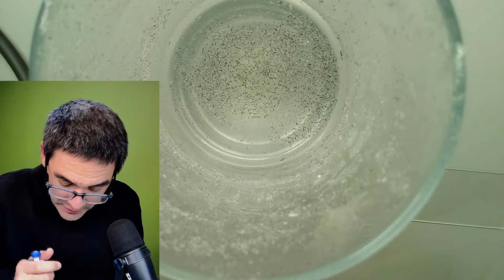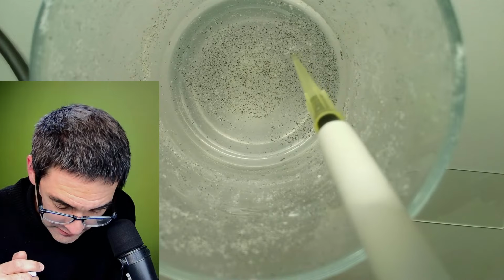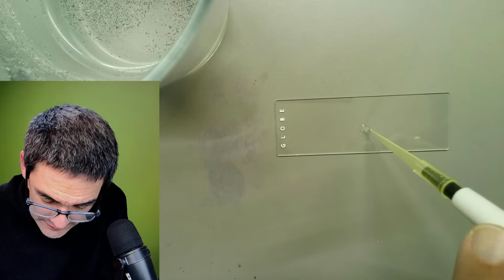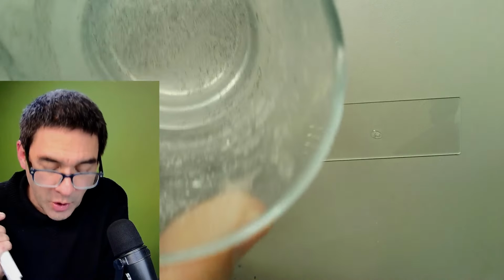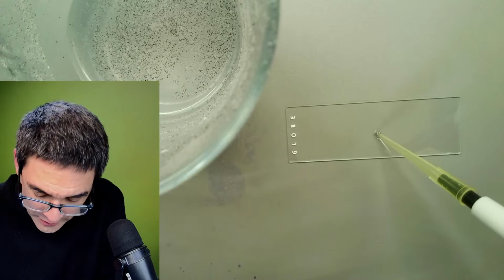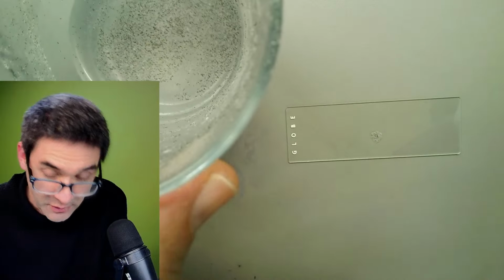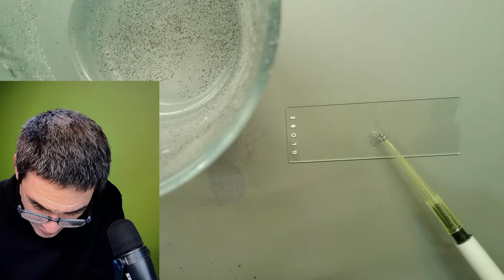Okay, no guarantees here, but what I have to do is take some of the sample here, and what I have done is it sticks to the tip. I tried to wash it as well. I tried to carefully remove the soap water and so on. And there are lots of skin cells in here as well, I've seen. Yeah, lots of it. Not surprising. Shouldn't surprise us. Look, it doesn't go off easily.